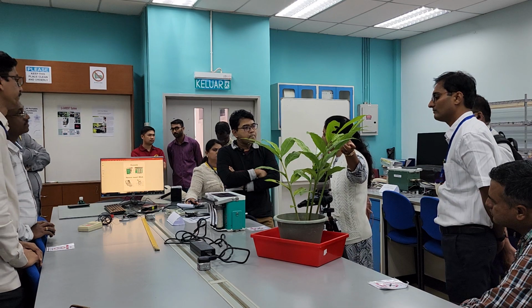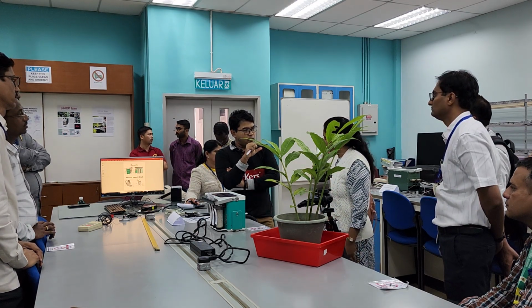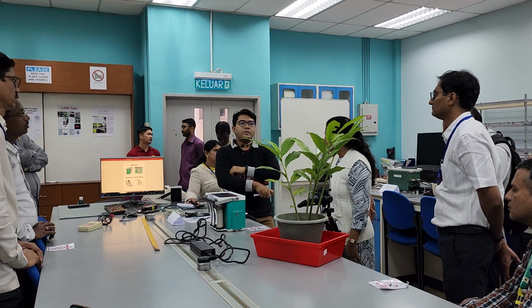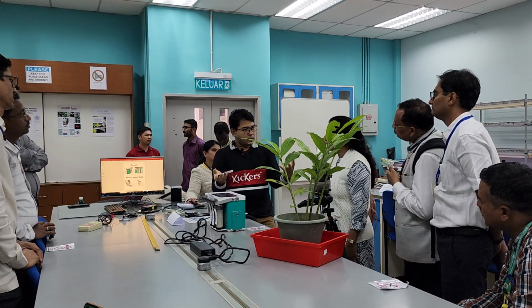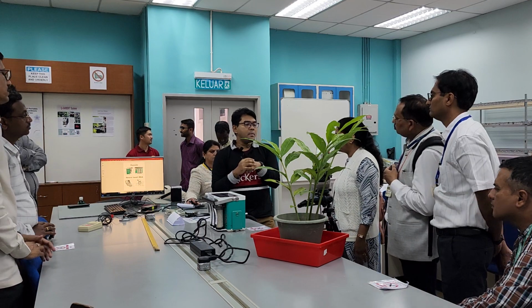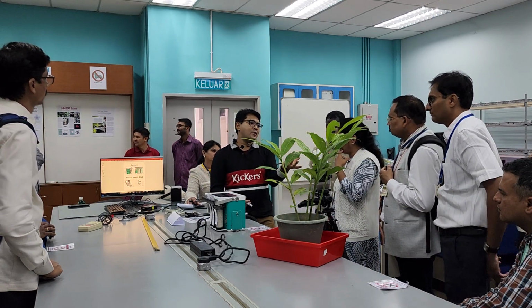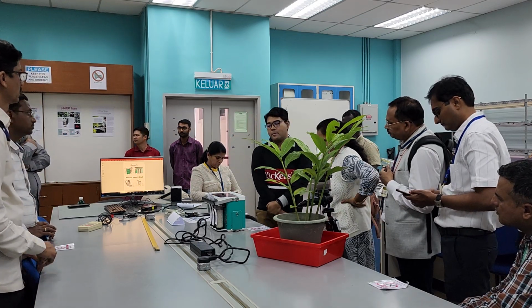Like Bryophyllum, some are thick ones, no? So you mean whether a thicker leaf, regardless of the thickness, will give off fluorescence? Not necessarily. Fluorescence is due to the presence of chlorophyll A, not due to the anatomy or leaf morphology. So maybe your leaf is very thick, like aloe vera, but the chlorophyll is very little, so very small fluorescence. It depends on the chlorophyll A pigment content. Exactly, the biochemistry of it.